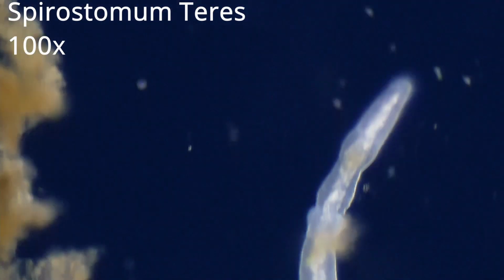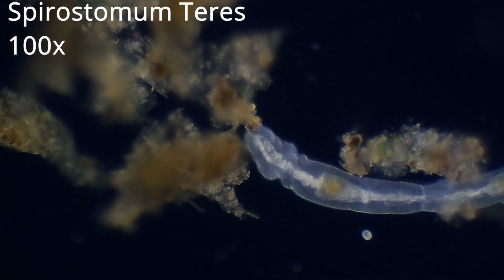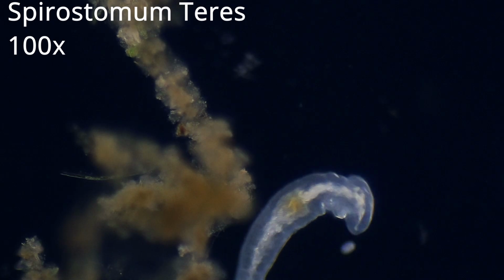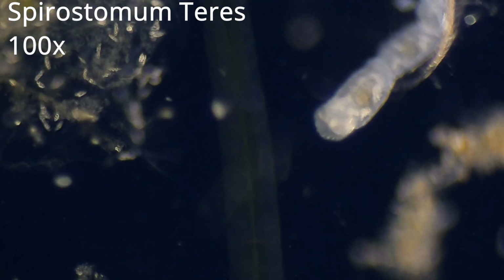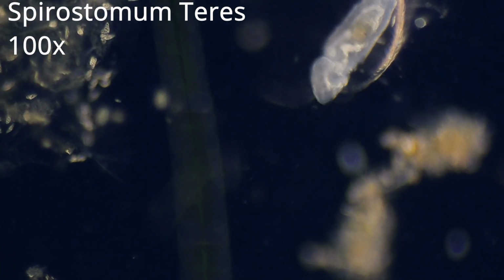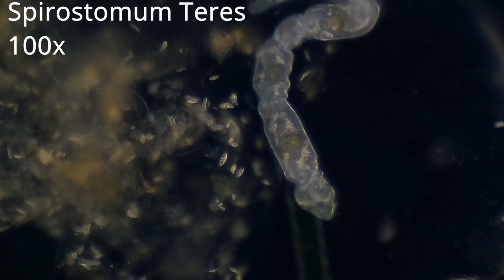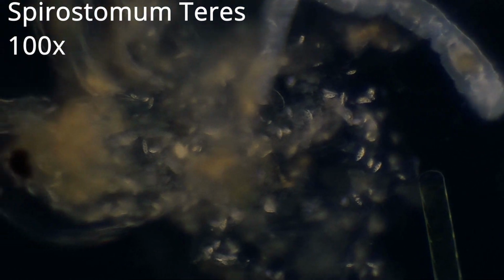They are about 1 mm long on average, so you can see them with low magnification or even with the naked eye. I have the impression they dominate their ecosystem. Only a few different species found there. Perhaps this is coincidence. The thread through their body is their DNA, called macronuclear nodules. The big spherical objects are their stomachs, called vacuoles.